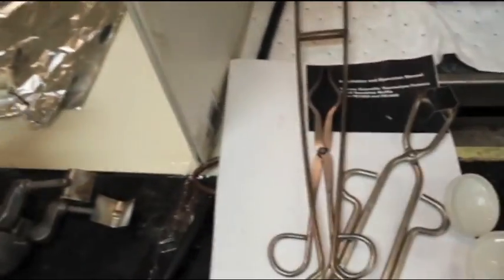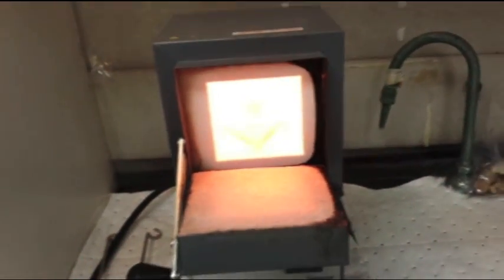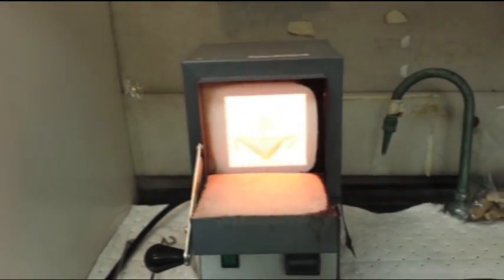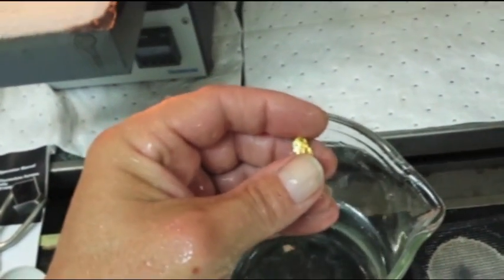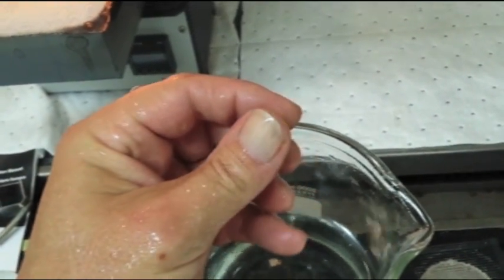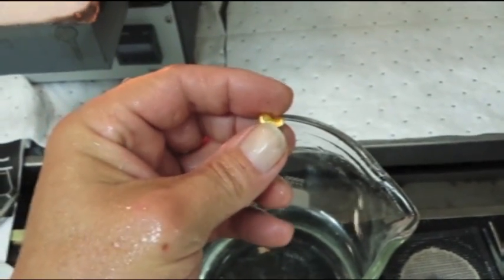Unfortunately, I couldn't show you, but there is our end result. Burn the end of my glove. And this thing is still really hot. We're going to let that settle down a little bit. But what we ended up with, it's a very nice chunk of 24 karat gold. In just a minute, I'll weigh this up.